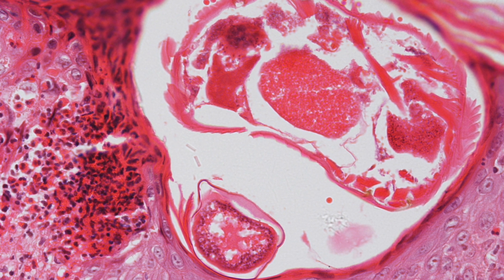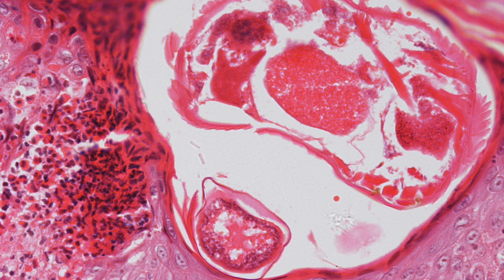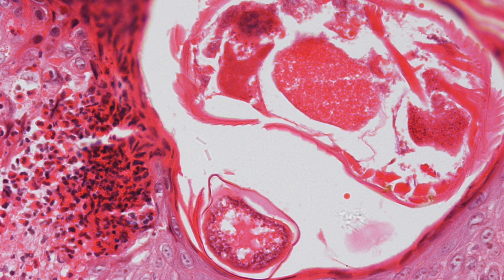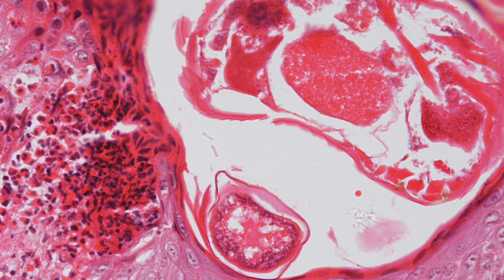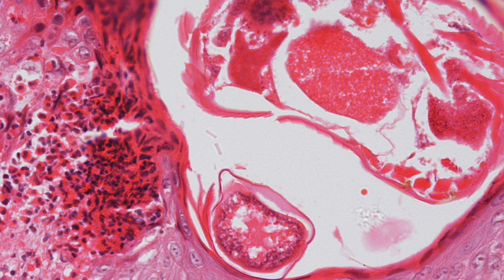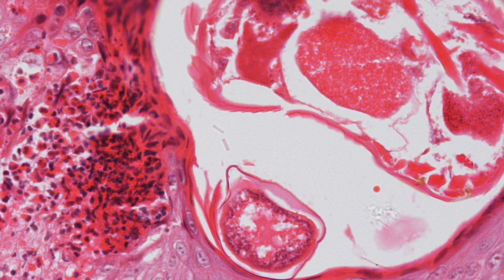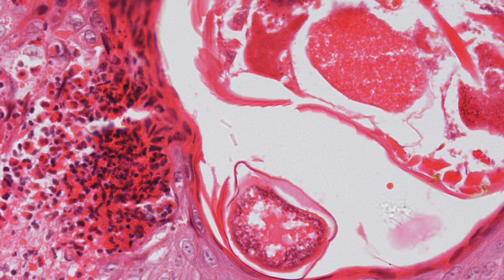To the left of the tunnel you can see a collection of eosinophil polymorphs in the epidermis extending into the dermis, and it is these that cause the itching associated with scabies.